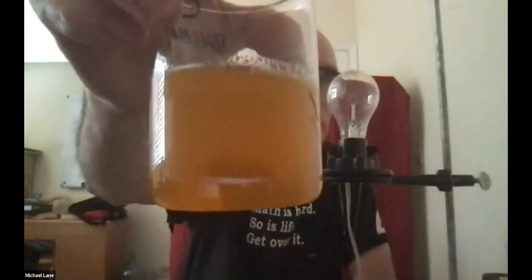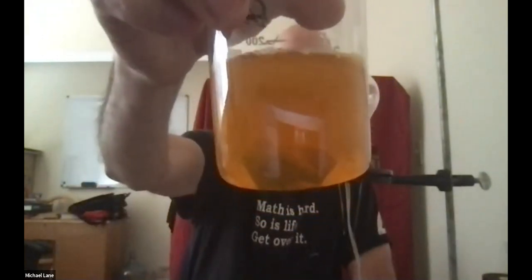So perhaps you can see down there in the bottom, let me get a couple little white pellets, very representative of the nature of sodium hydroxide. So I'm going to put some water in there. Now I come back to this one, and let me swirl it just a little bit, maybe stir it up a tiny bit. So you can see the solution is beginning to turn slightly orange, which again tells me that the iron is dissolving because now it's in solution.